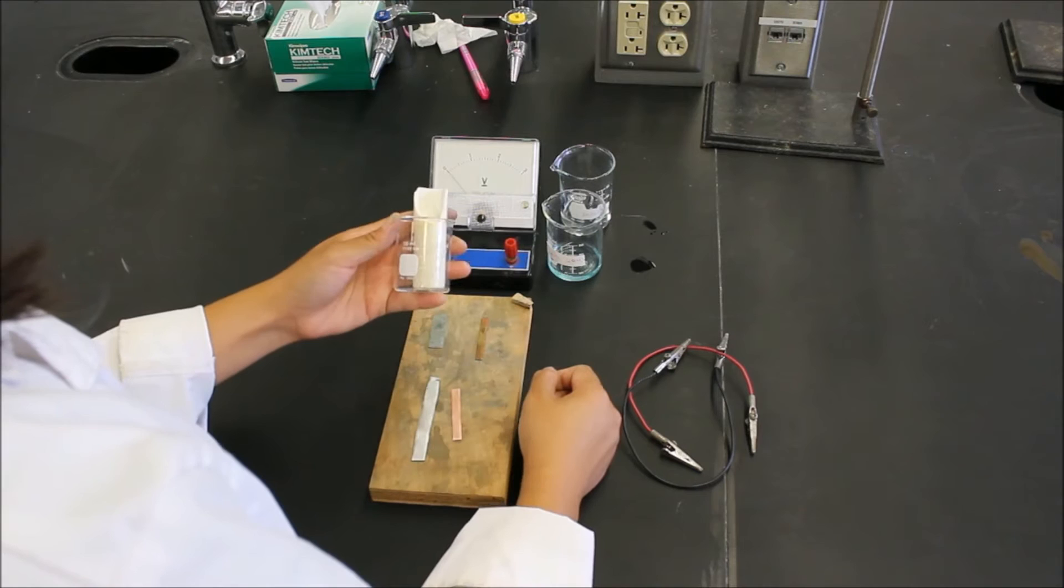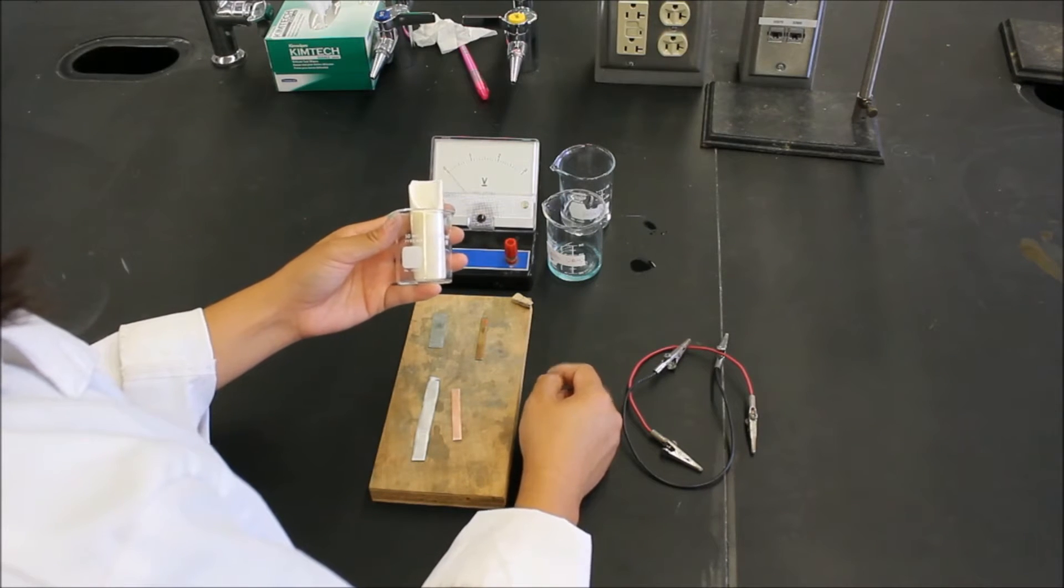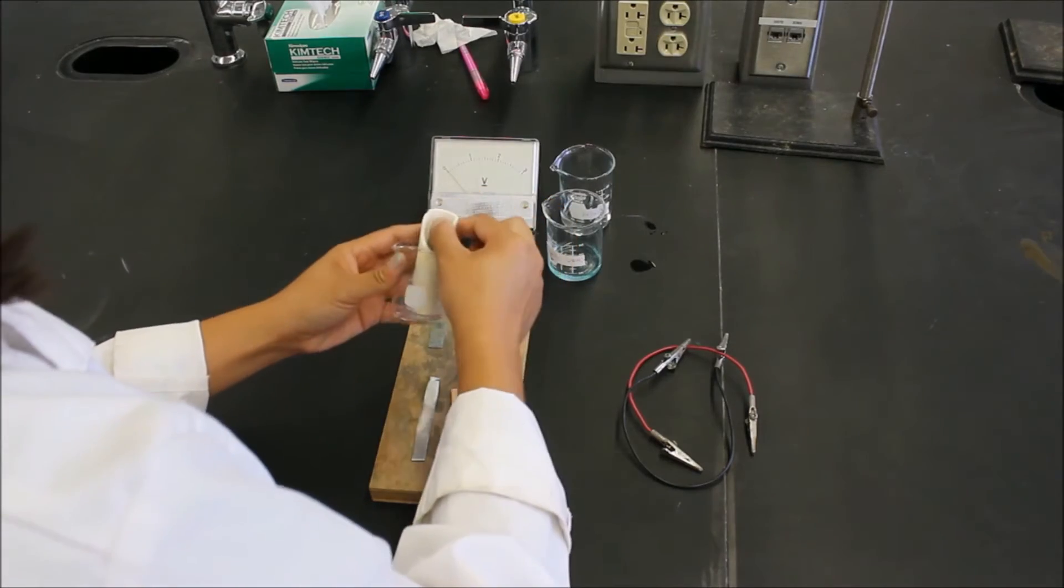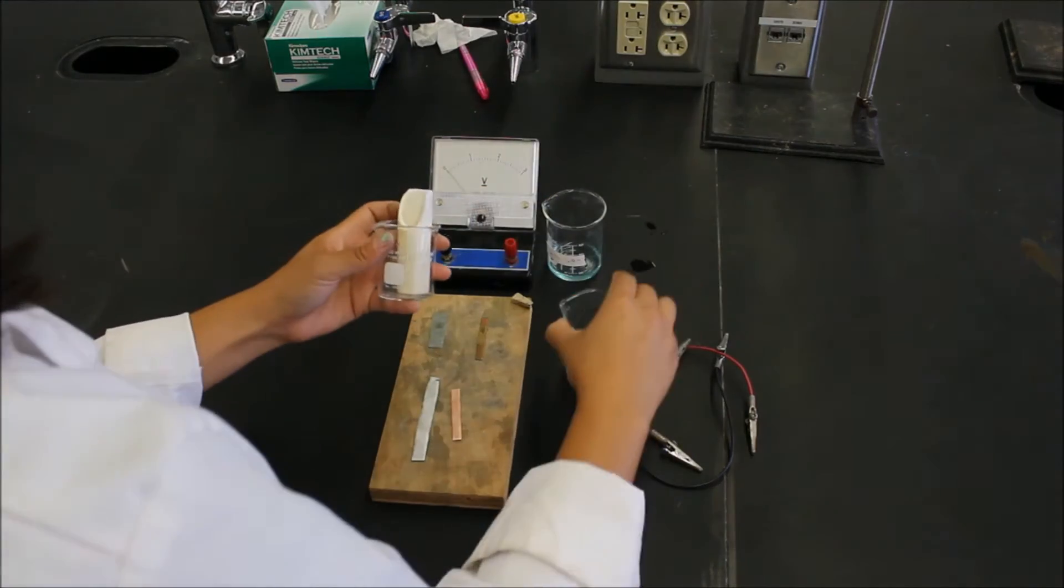When we fill these with solutions, we want the level of solution in the outside cell to be about the same level as the inside cell. So let's go ahead and fill them up.